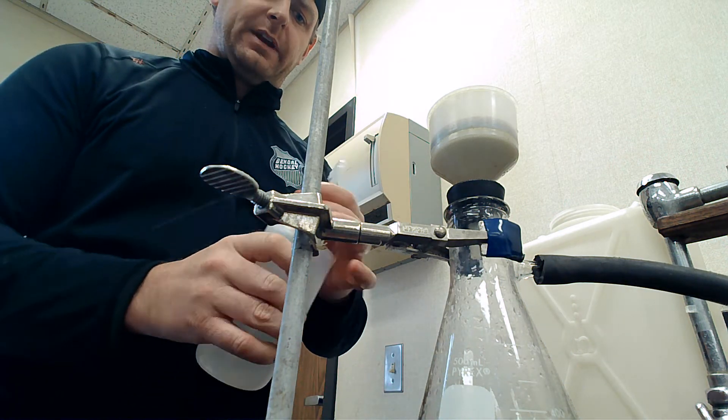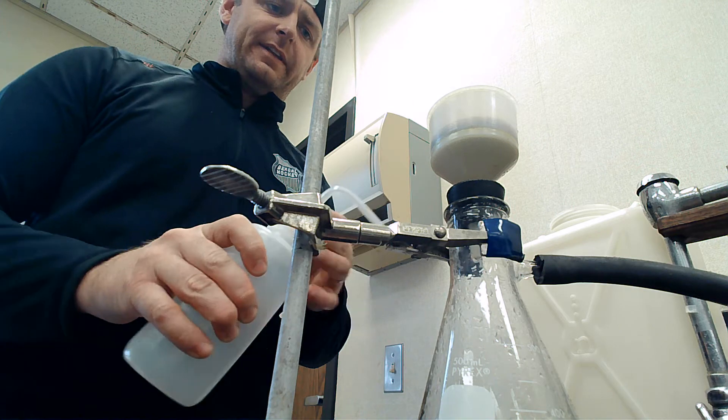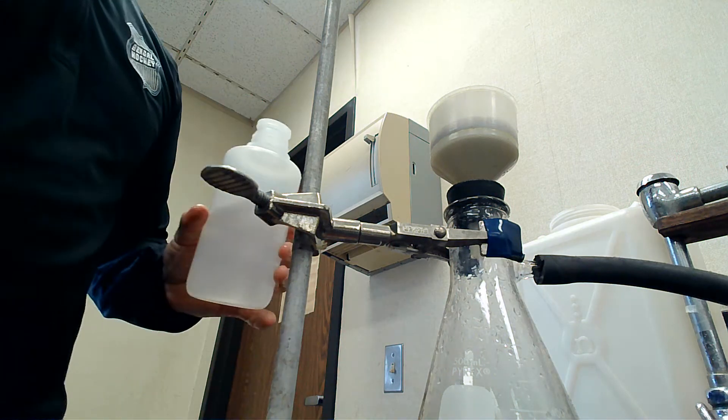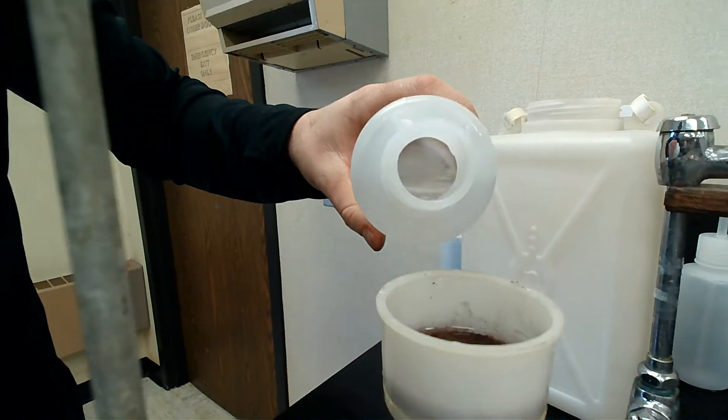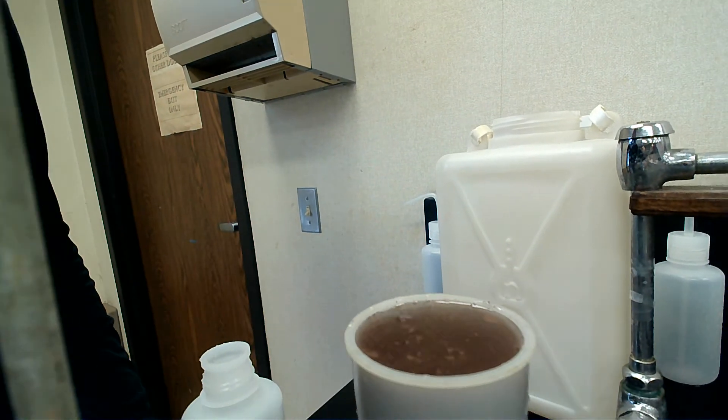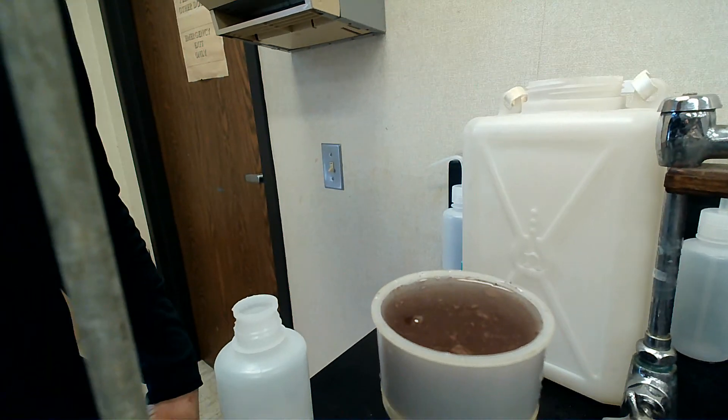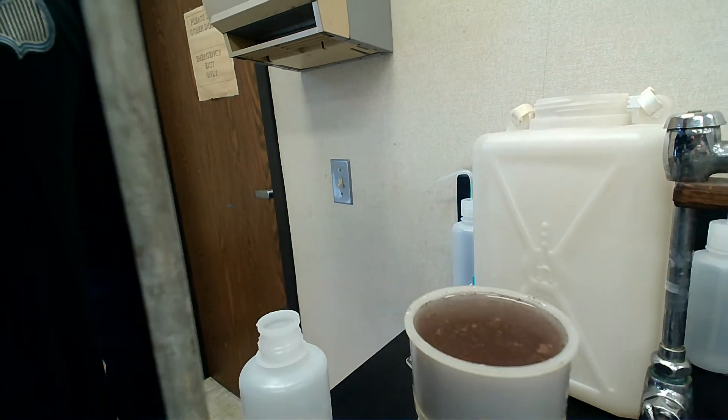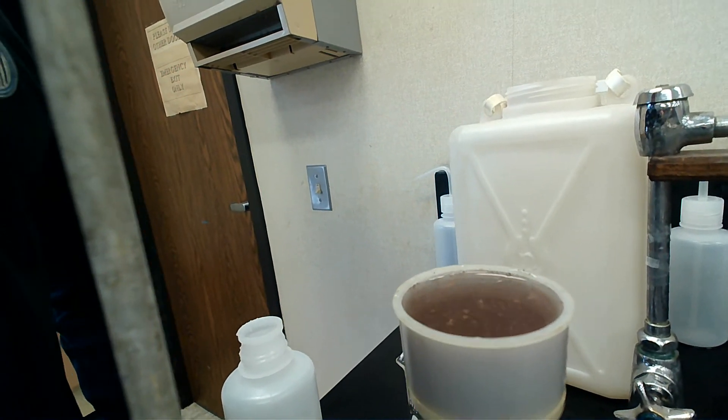We want to wash it because there's a lot of hydrochloric acid on there. We just want to fill it up and wash it with water to get all the chlorine molecules out so it doesn't go back to copper chloride. I'm going to let that filter out.